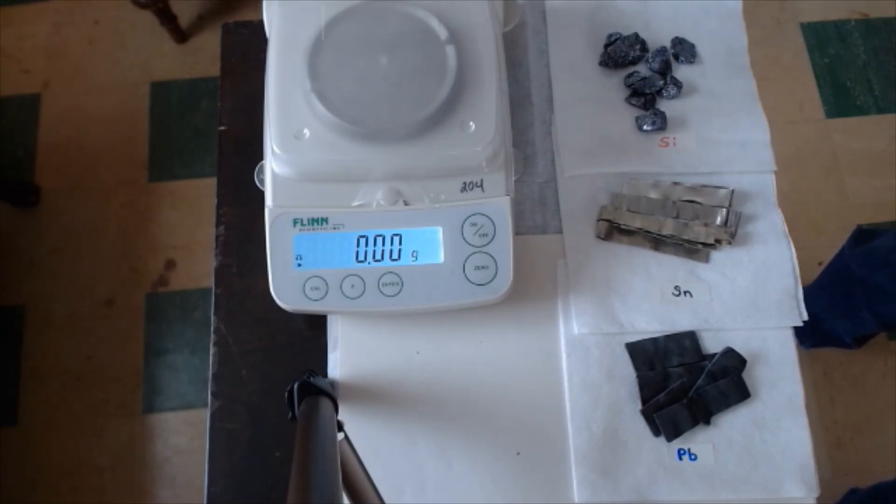Then we're going to see how close we came. You'll calculate the percent error. And then, of course, I always have you answer a few questions about the lab.